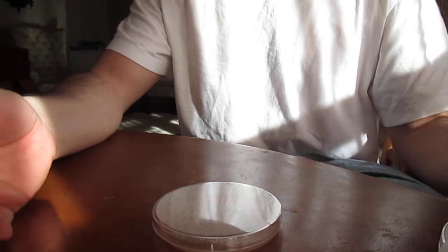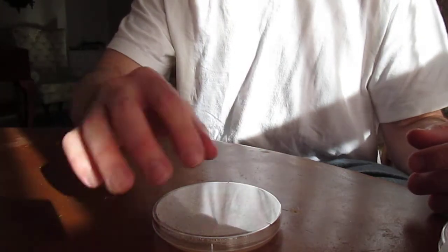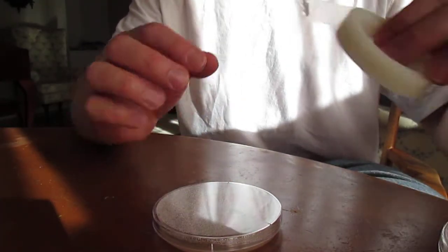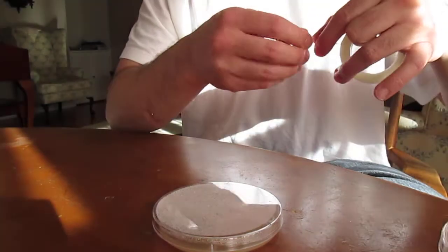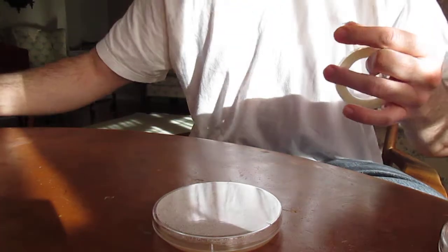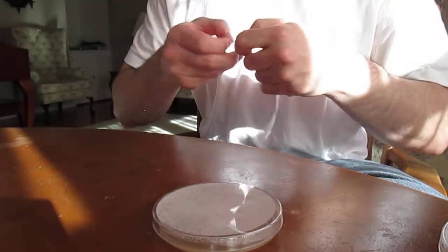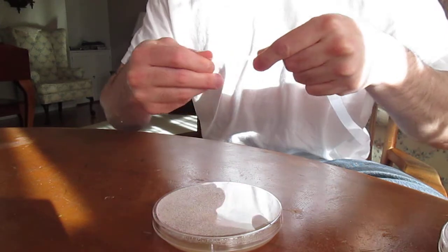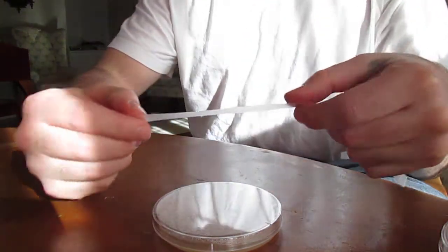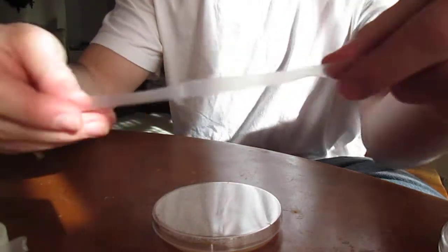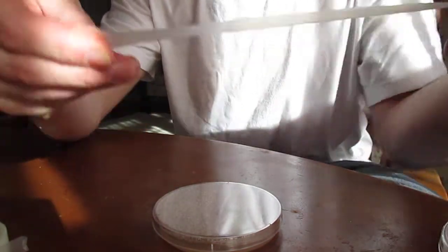If there's any kind of airflow, there's a chance the agar will get contaminated and won't be any good for what I'm using them for, which is to isolate strains of mushroom. Right here I have parafilm. Take a piece of parafilm and what you need to do is stretch it out a little bit, otherwise it won't stick.